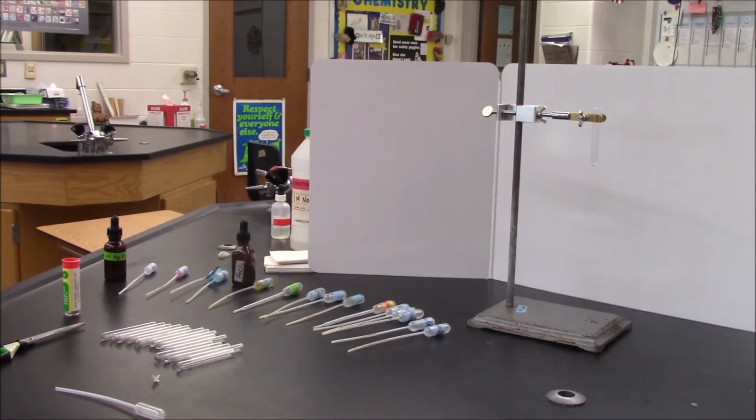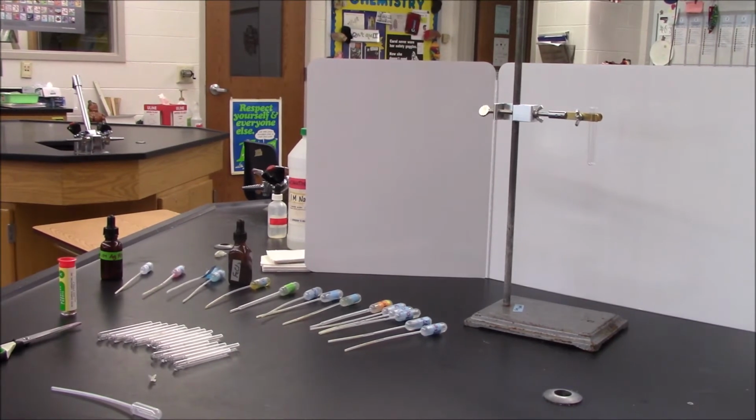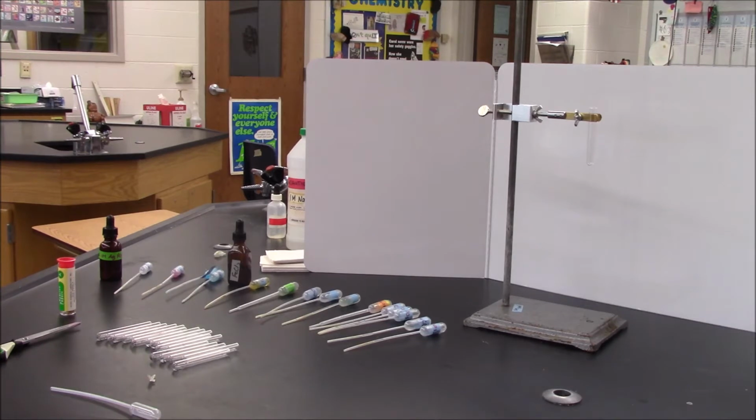Morning guys. Today what I'm going to do for you is carry out the double replacement reactions lab. In this lab, you're going to watch me perform 15 double replacement reactions. Together, we're going to make observations and identify what was formed. After the video, we are going to write in the products and maybe even balance these equations.